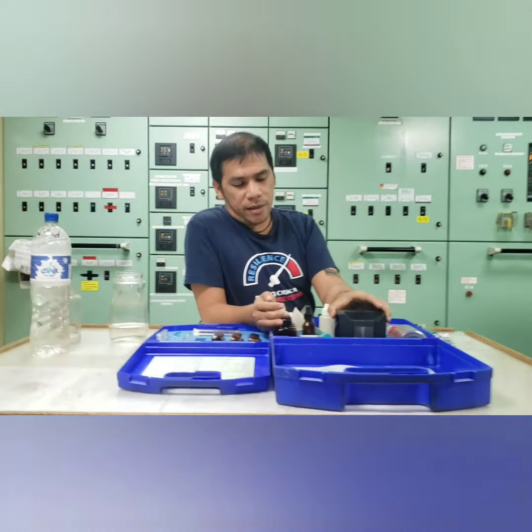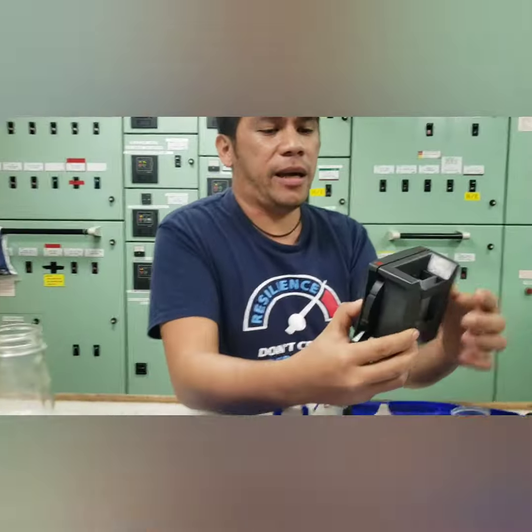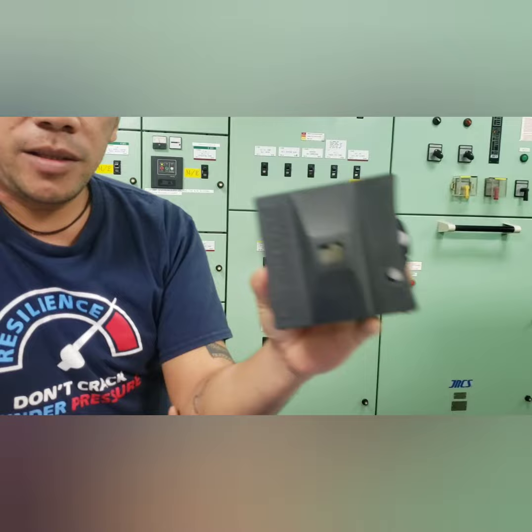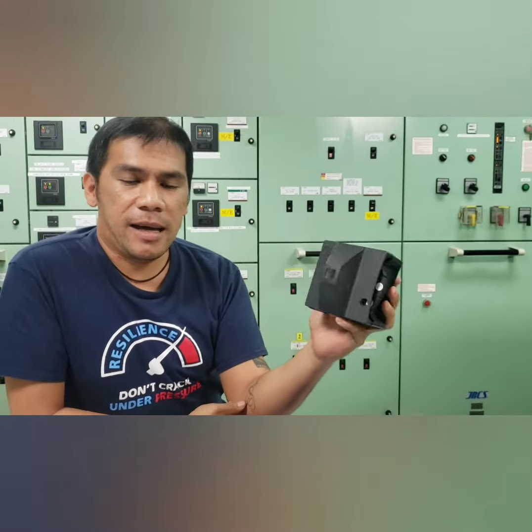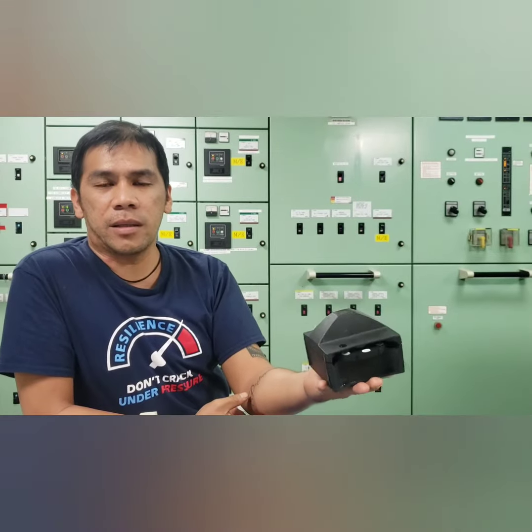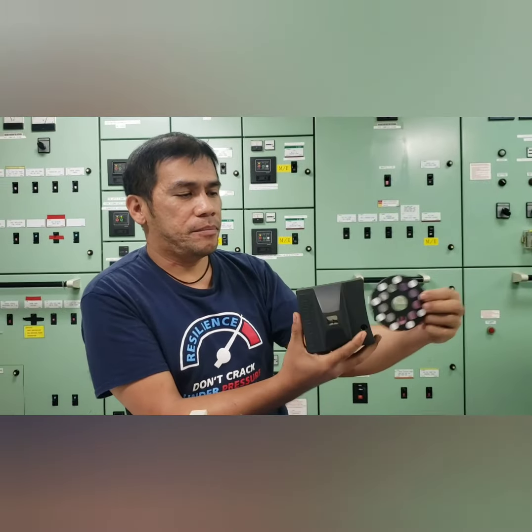First is equipment used taking a DEHA. So we will discuss this DEHA when we are in our topic about the boiler water. So for this time, I will show you this equipment.